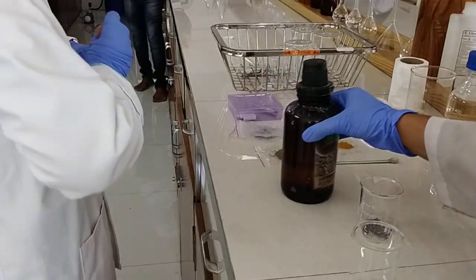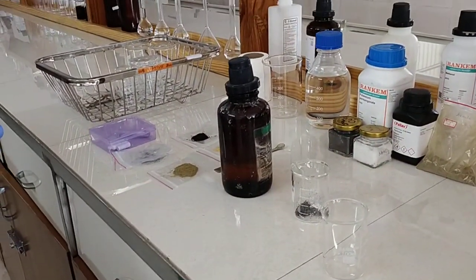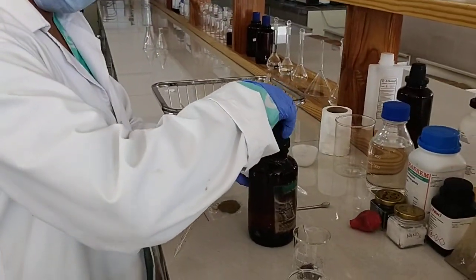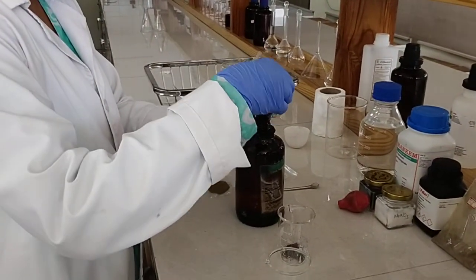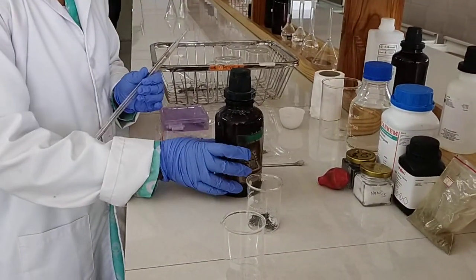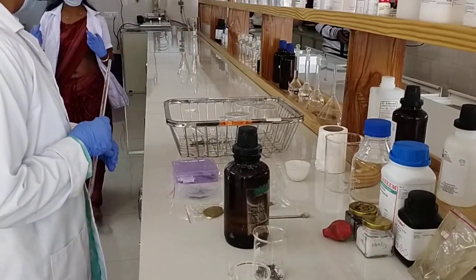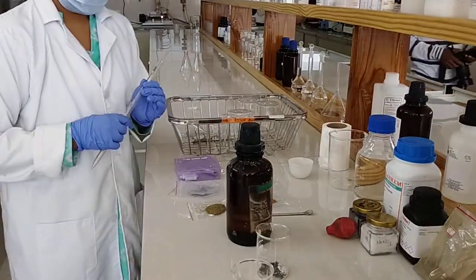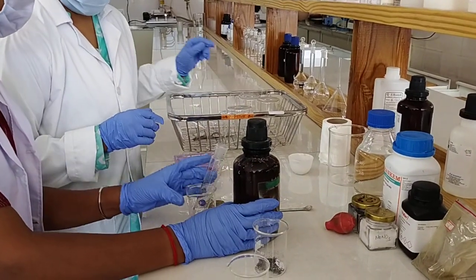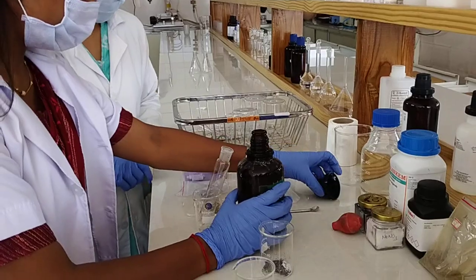Please give me a test tube. Shall I? Or you? How much? 22.